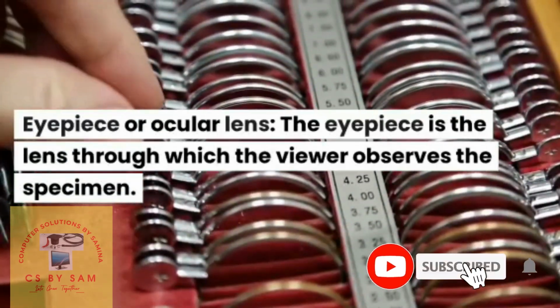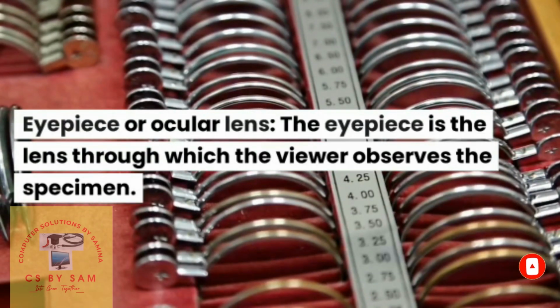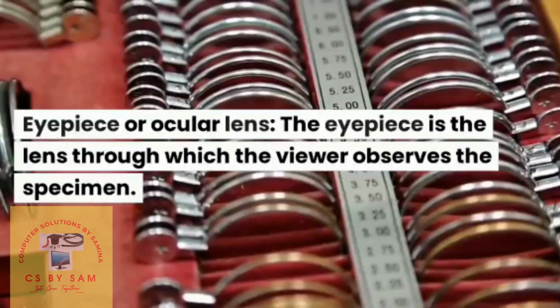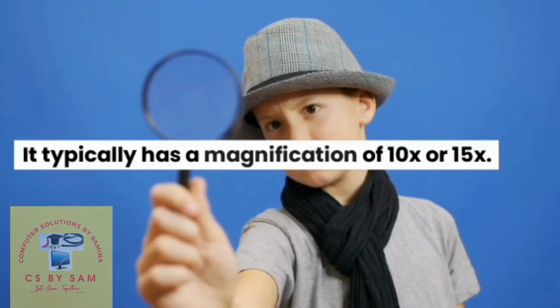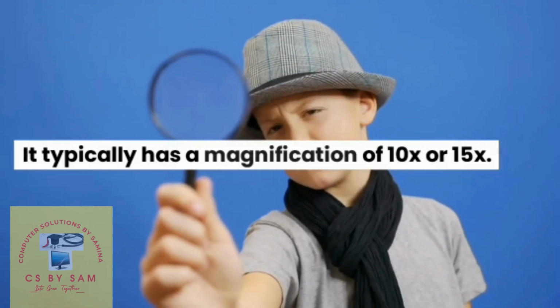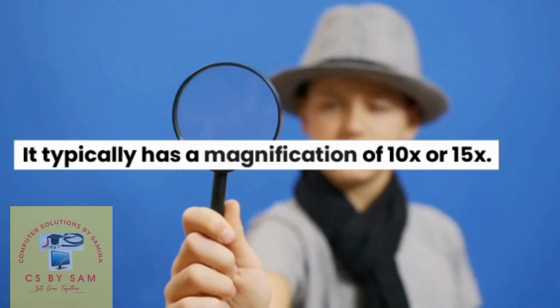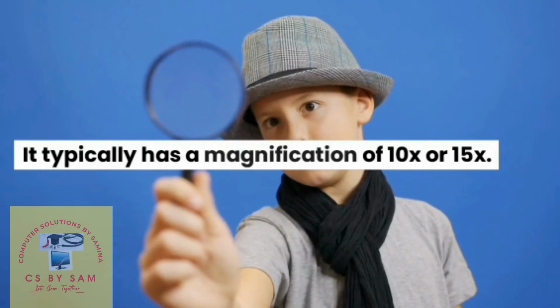The first part is the eyepiece, or ocular lens. The eyepiece is the lens through which the viewer observes the specimen or the object being observed under the microscope. Typically, the power of an eyepiece to magnify the object is 10x or 15x. However, the microscopes present in the laboratory normally contain a 10x eyepiece lens.